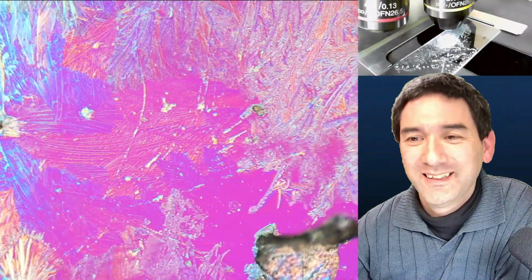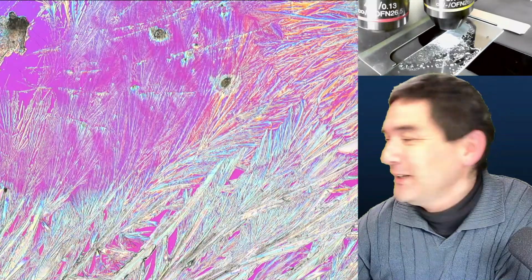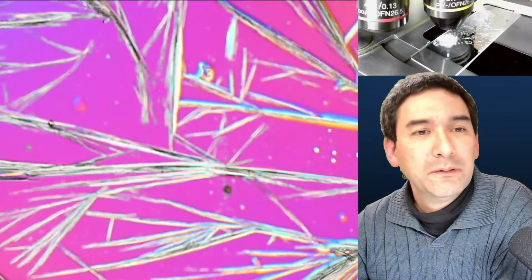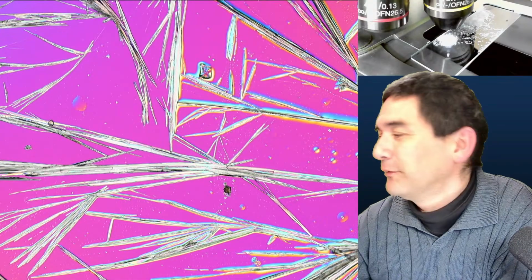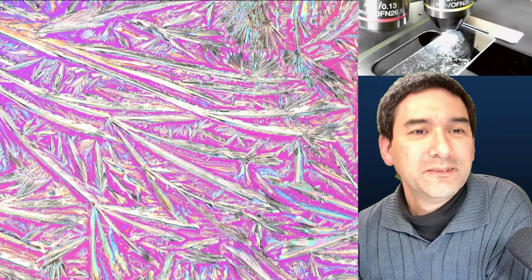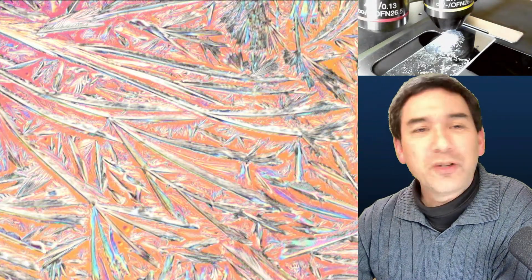Looks cool. Yeah, it looks pretty nice. And let's have a look again over here. This is the place where I had the water. And I think somewhere over here. But no big difference. And here again. So this is actually quite nice.